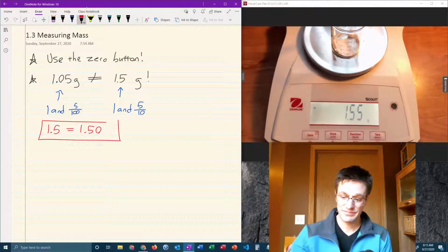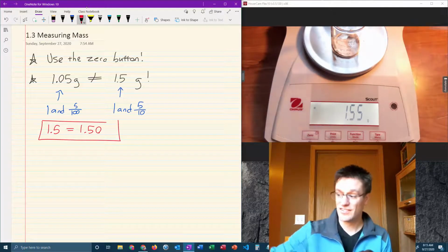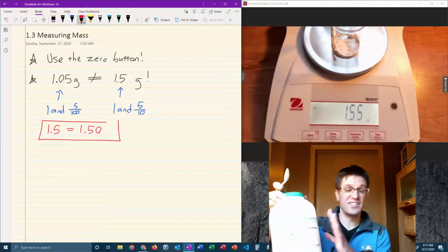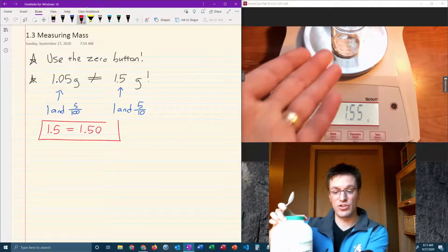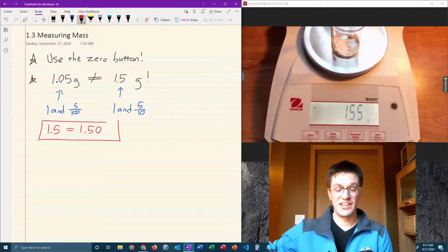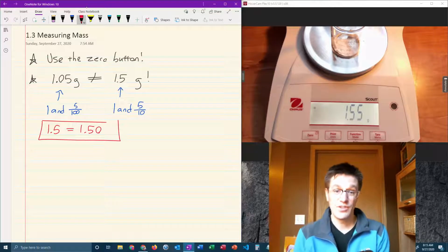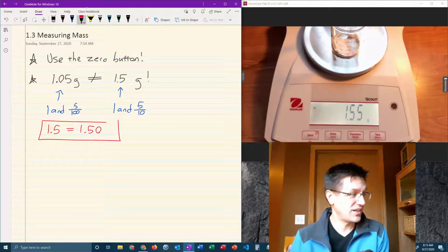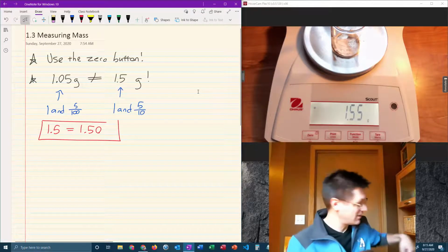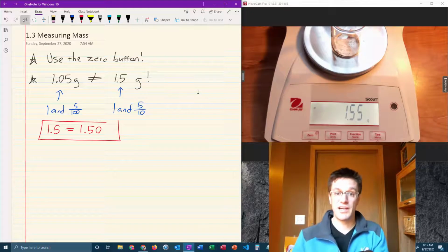You can never take chemical back out of your sample container and put it back into the reagent bottle because we don't want contamination in here. I don't know how clean this beaker is or this spoon, and we don't want any of that dirtiness to get back into the original source bottle. And really that's it. If I hit the 0 button and I understand the numbers and I know not to put anything back into the reactant bottle, then I'm using a balance like a pro.